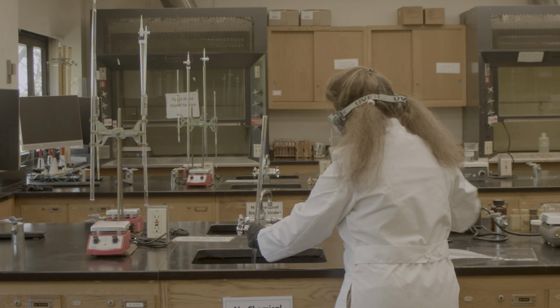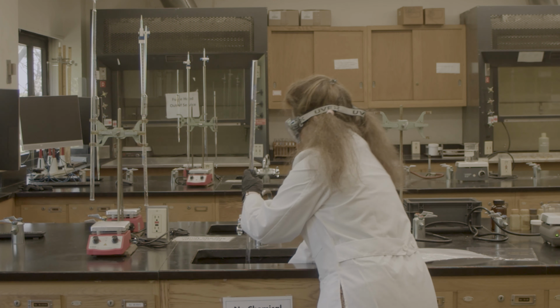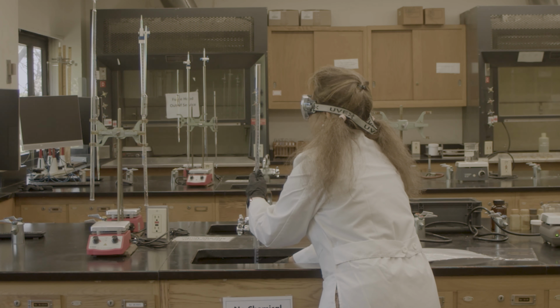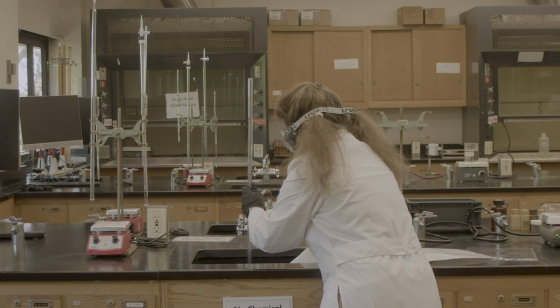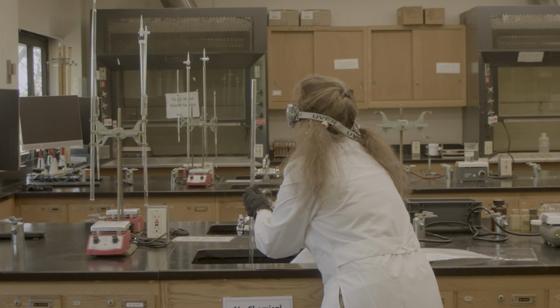When you read, it should be at eye level so that you can read the exact mark. Remember, nothing is pouring into the sink. Okay, I got the exact amount.